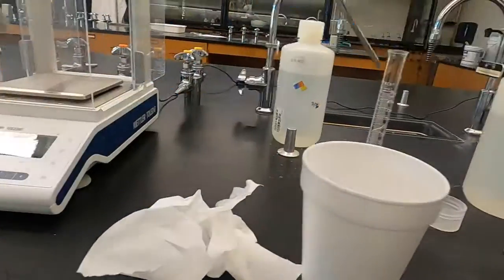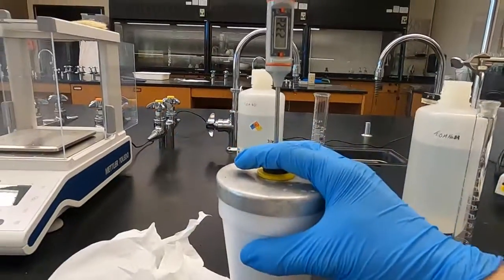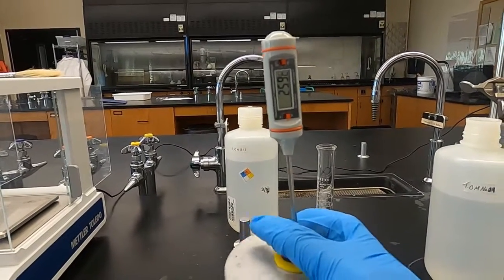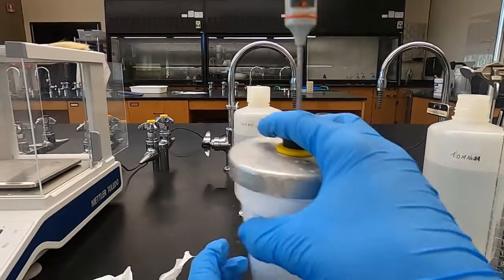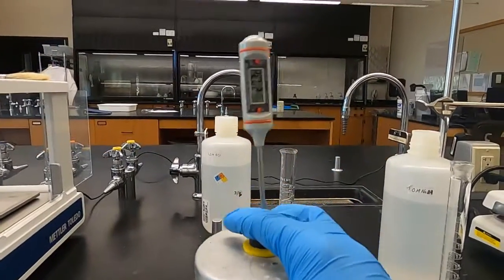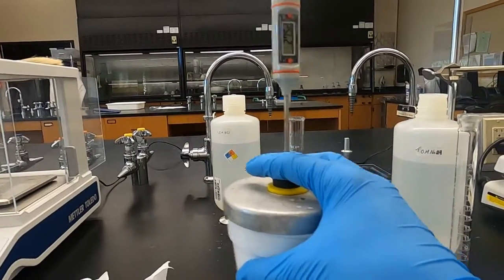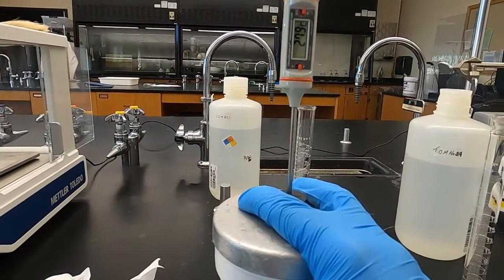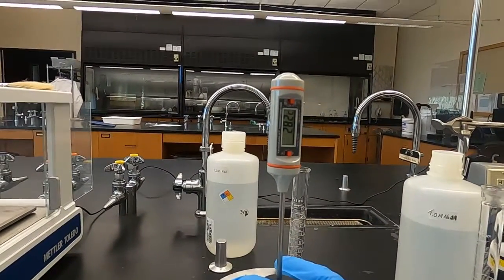During this, we'll be wearing safety goggles, as I am. So if you're in the lab, safety first. I already have the gloves on, and we are on the rise with this reaction. 25.9 so far, still on the rise. I can feel the warmth on the bottom as well. Something we couldn't feel earlier with those other ones, but this one is definitely already higher than them. Keep mixing. 28.1 so far.